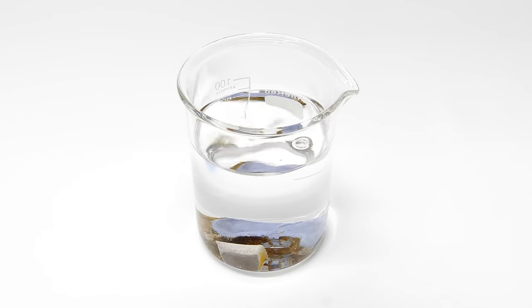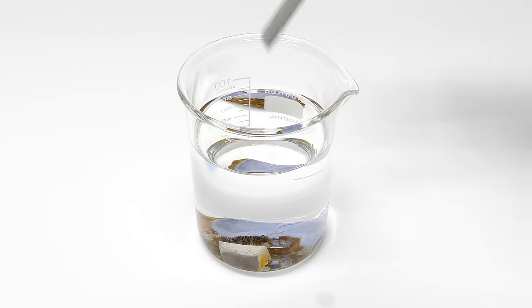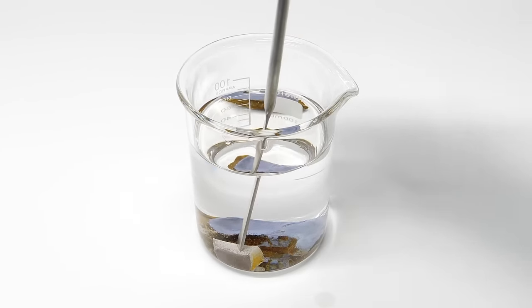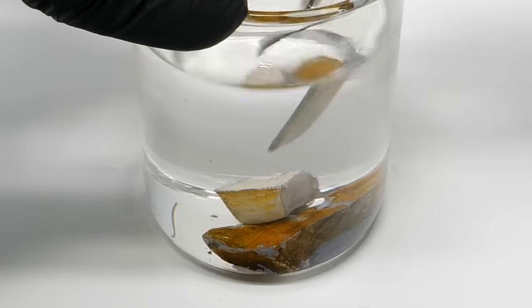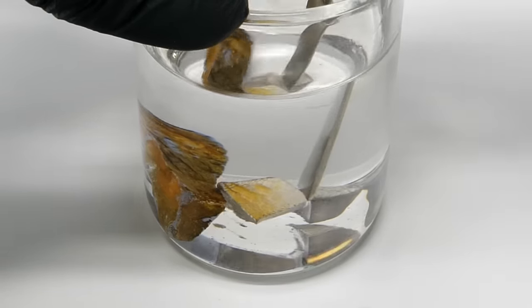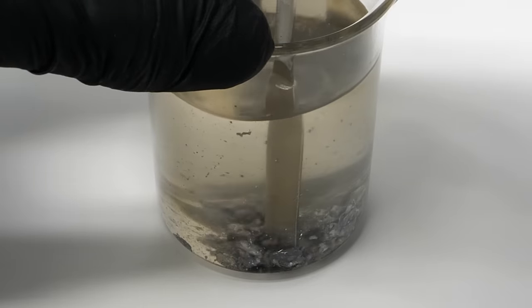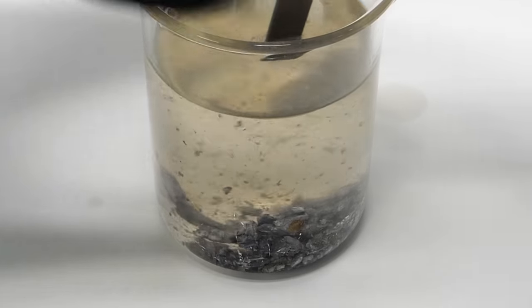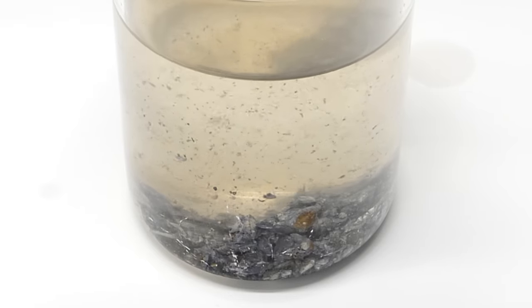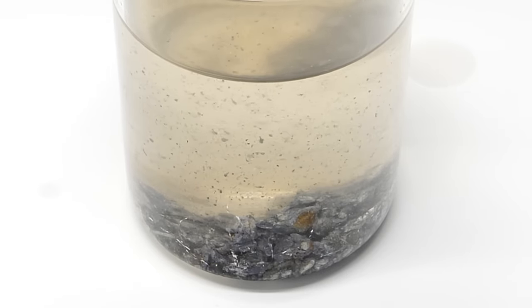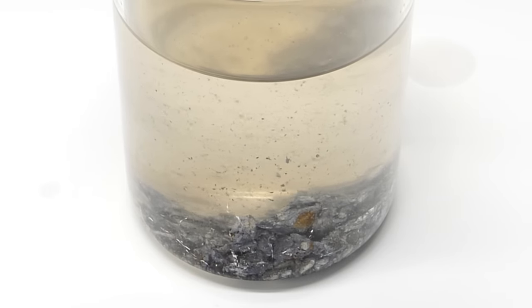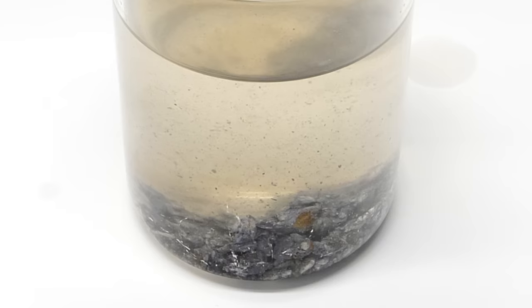I'll add this to the kerosene and the potassium, and now I can start chopping them up. It took a few minutes of stabbing, but I was eventually able to break them into a bunch of small pieces. At this point, it just looks like a pile of junk, but this should change when I start squishing it.